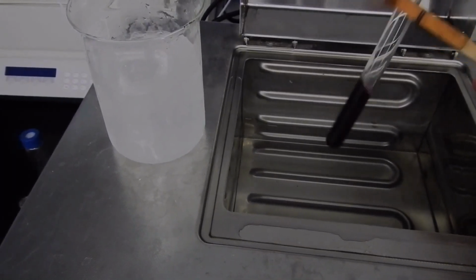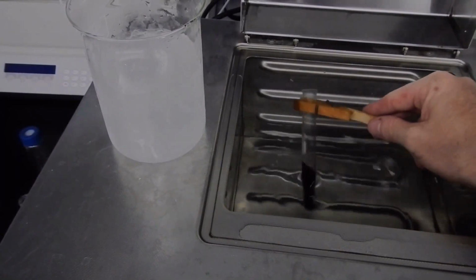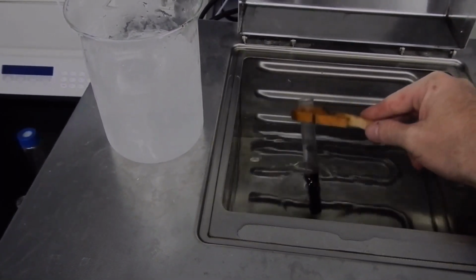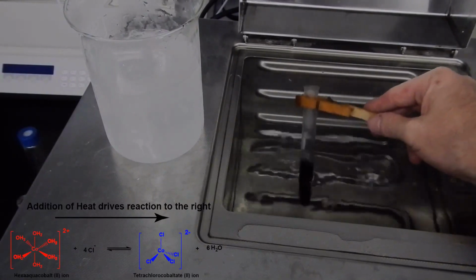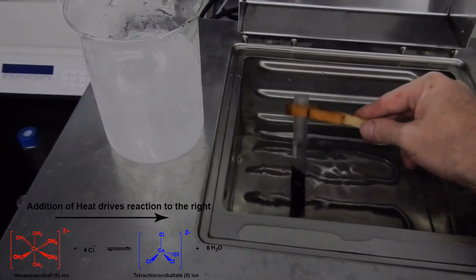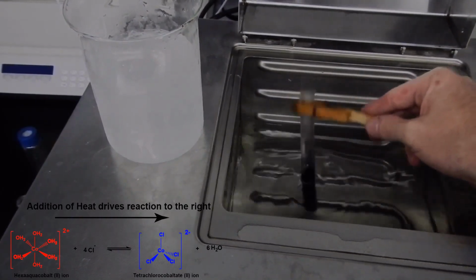Now, we can actually change the position of this reaction by changing the temperature. So I'm just going to dip it into this water here, which is at around about 70 degrees Celsius. And we can see that it's slightly changing color before our eyes, going to a more purplish blue color. And hopefully we can change it all the way to a blue color.